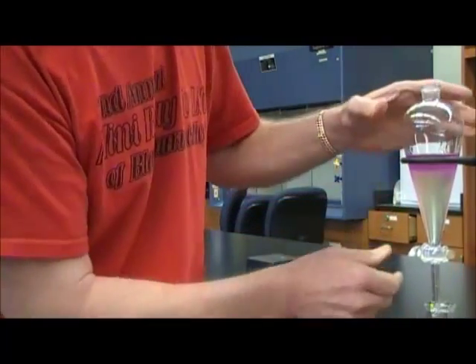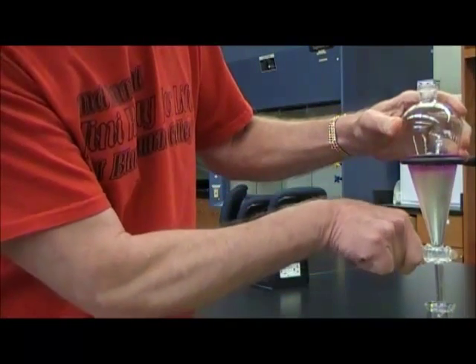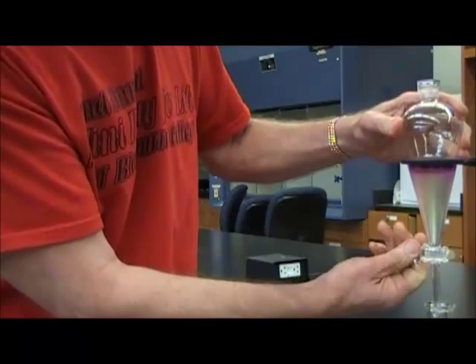And again, drain the bottom layer into a separate container.